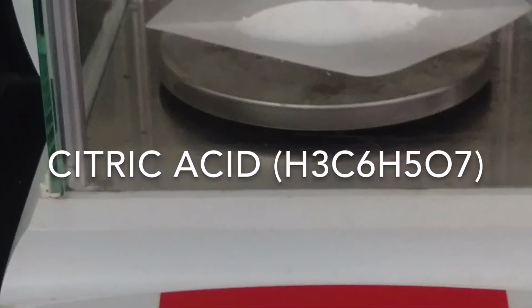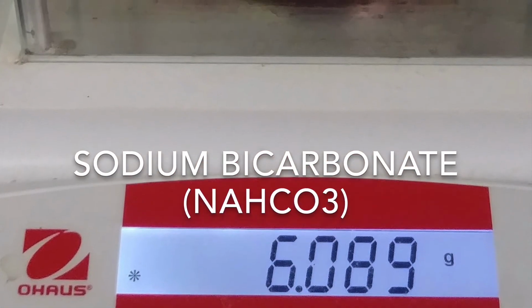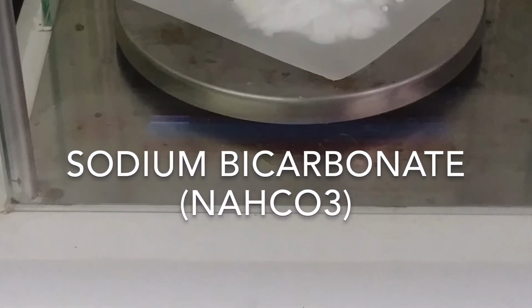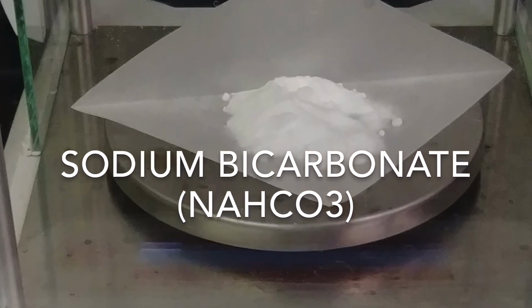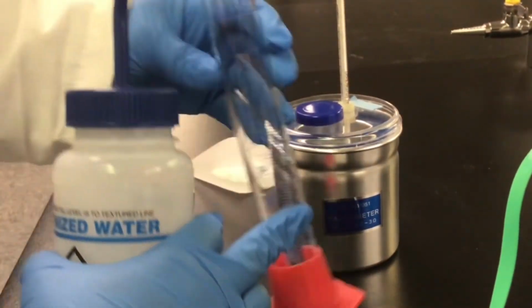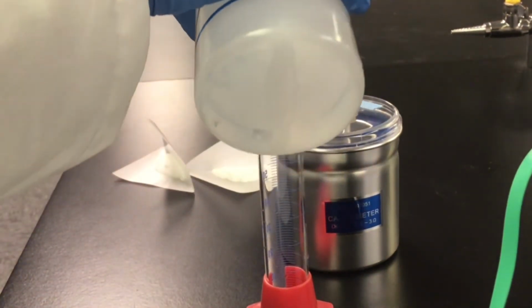Then, we will measure out approximately 6 grams of the sodium bicarbonate. Pause the video and record the mass of the sodium bicarbonate. Using a graduated cylinder, we will measure 40 milliliters of deionized water.